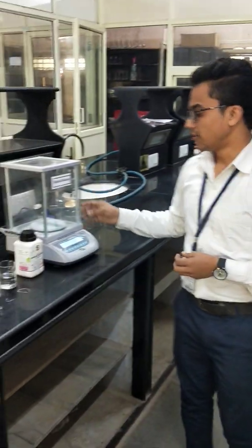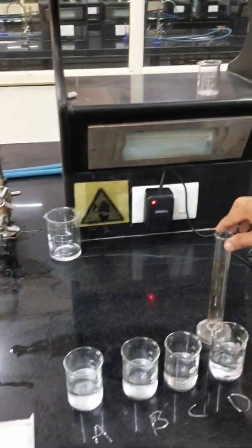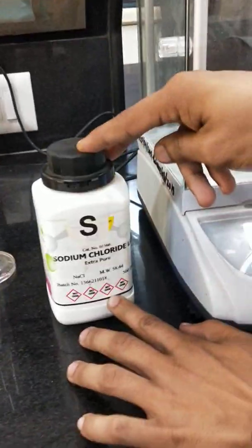The aim of today's practical is to study the effect of concentration on the rate of evaporation. The requirements for this practical are: first, a digital balance; second, a beaker; a measuring cylinder; and the chemical sodium chloride.